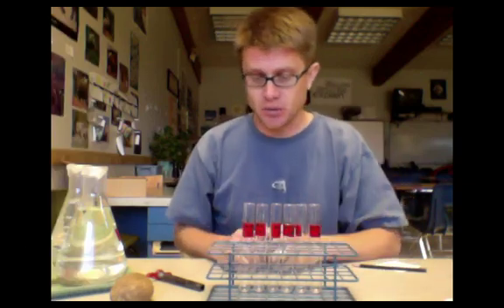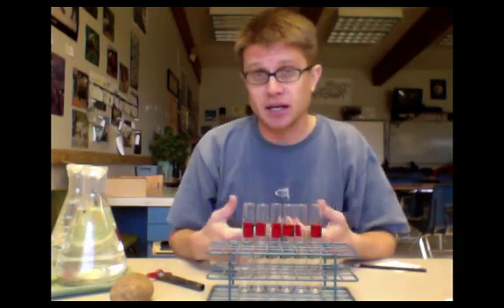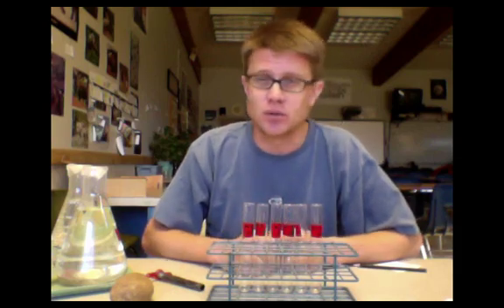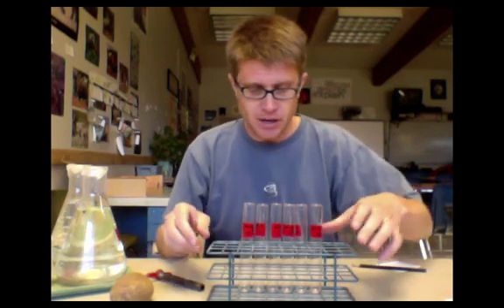So the lab is pretty straightforward. We're going to put potato cores in each of these. We're going to get their mass today and then we're going to let it sit overnight. Then we're going to get their mass again tomorrow and see what changes we see in the mass of the potatoes over time.